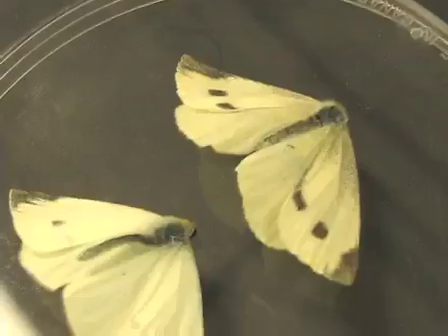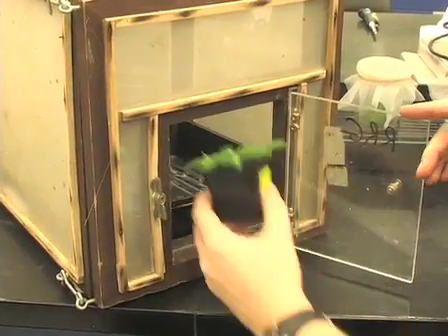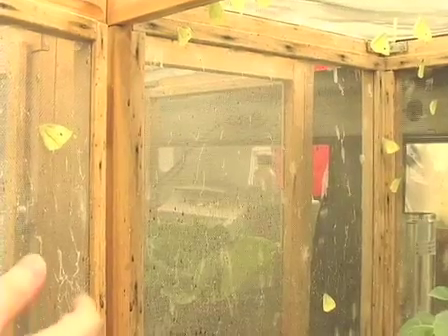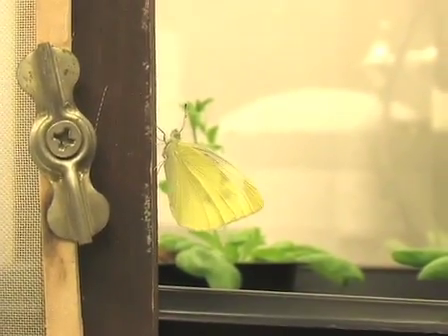For this choice experiment, we're using this cage. I put in both the wild type and the mutant plant, and now I'm going to add one female butterfly to assess the egg laying. I catch females that are actively laying eggs to make sure they're fertile, and carefully transfer the butterfly into the test cage. We leave the butterfly in for 24 hours and then count the number of eggs laid on each of these genotypes.